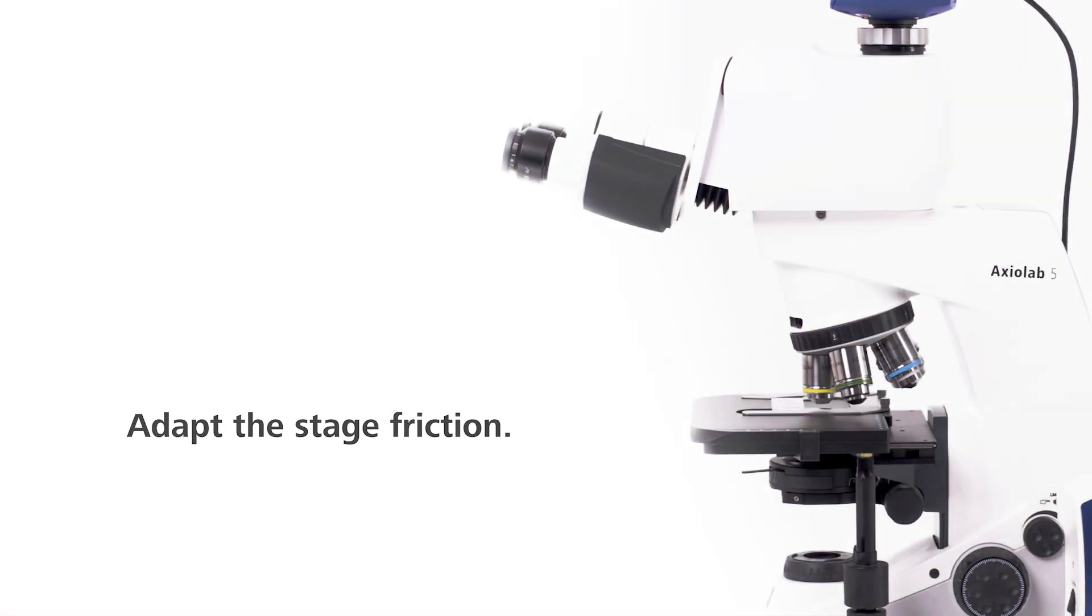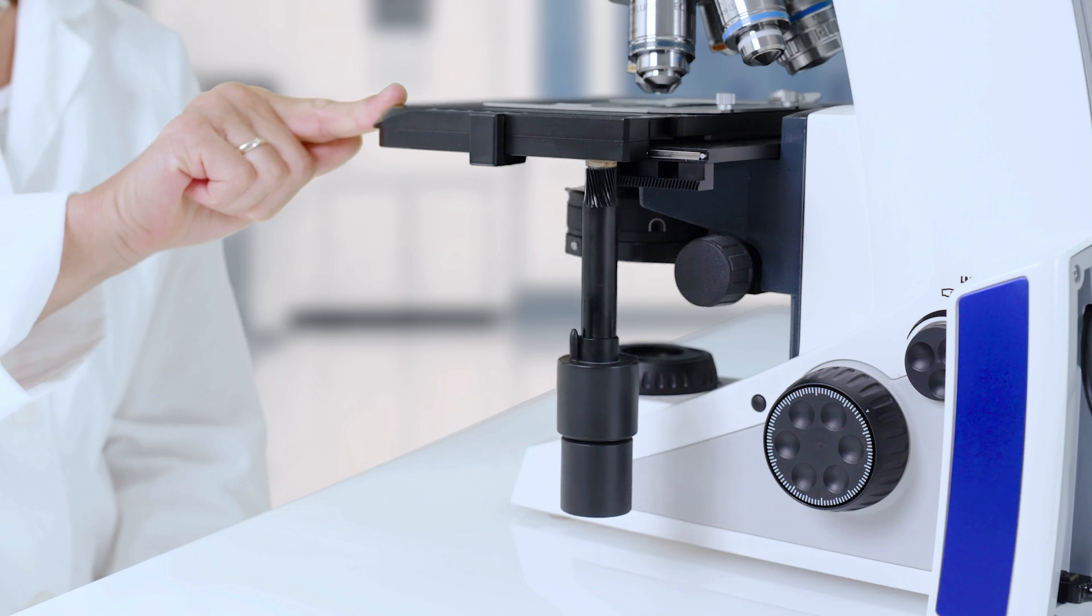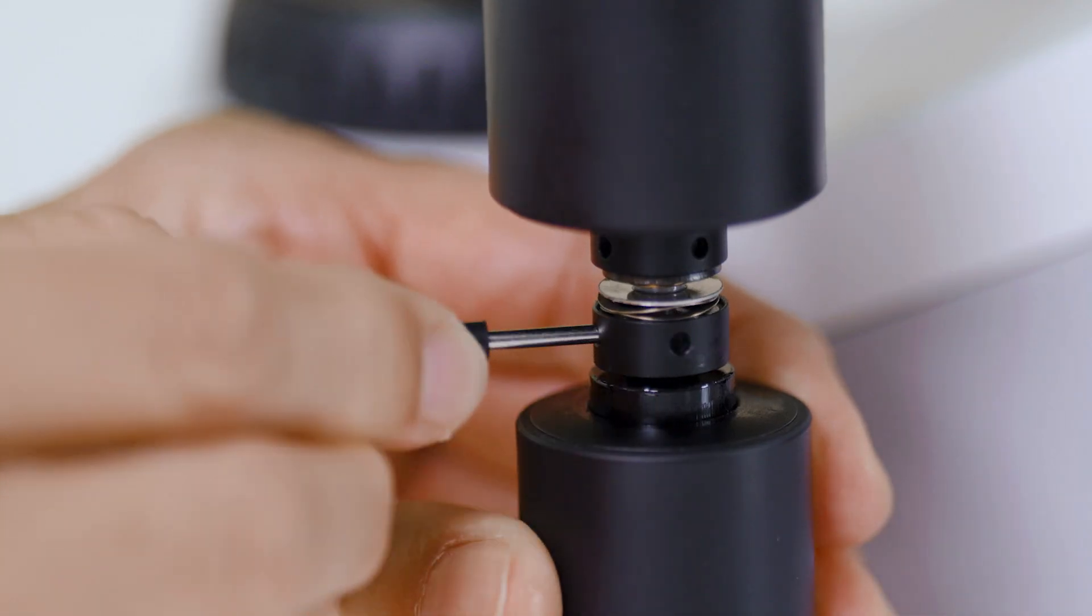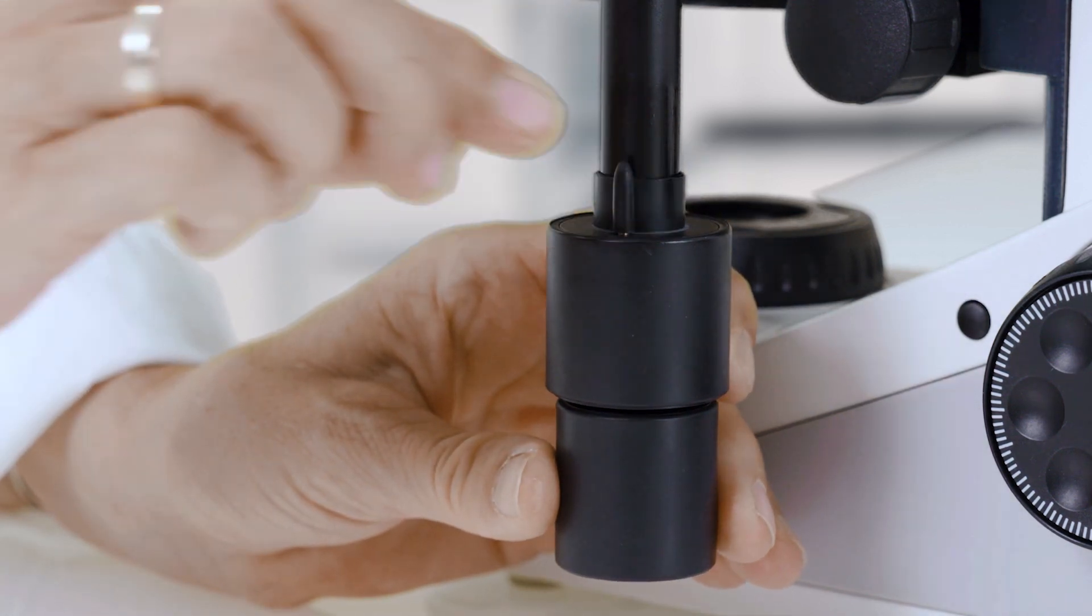Fine-tune stage control for smooth movements according to your demands and preferences. Adjust the torque for better control or smoother movement.